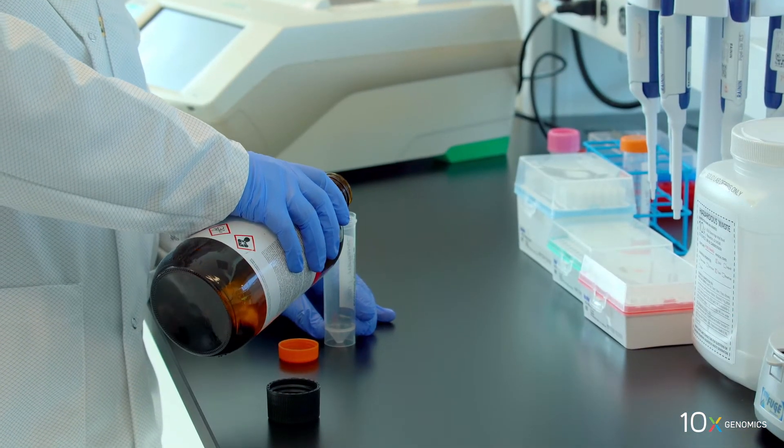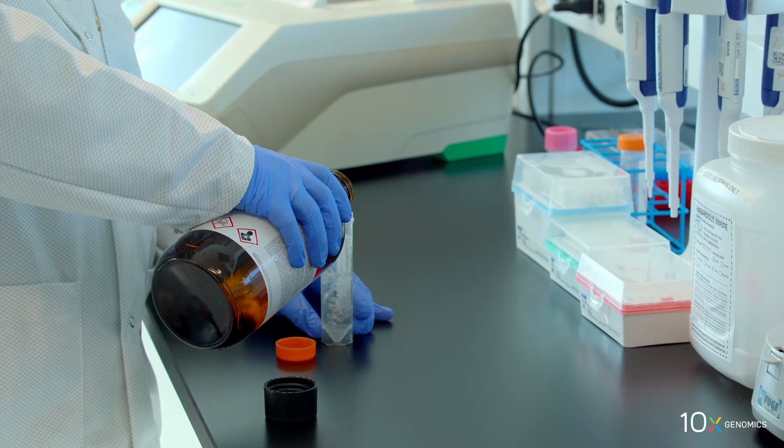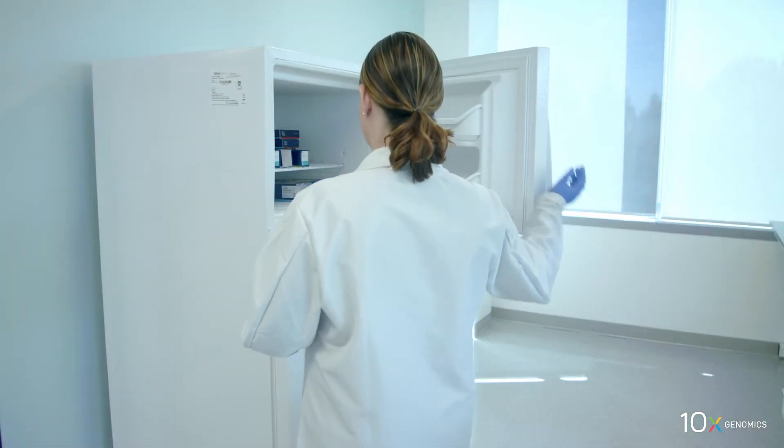First, we have methanol dispensed in a 50 ml centrifuge tube that has been chilled to minus 20 degrees Celsius.